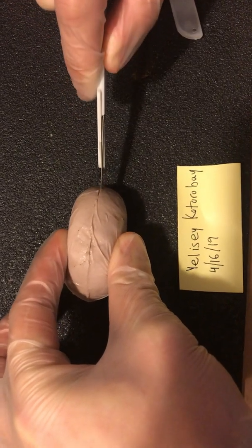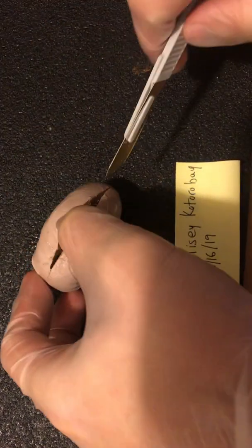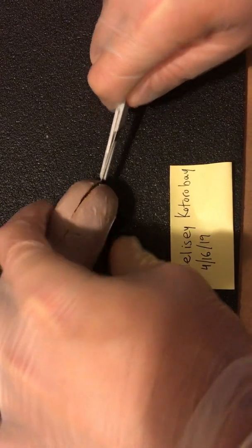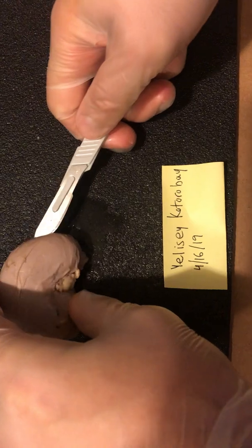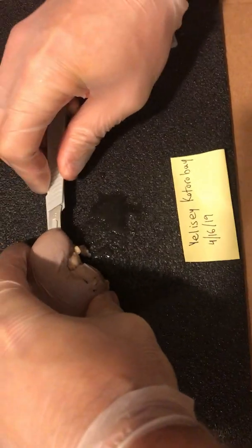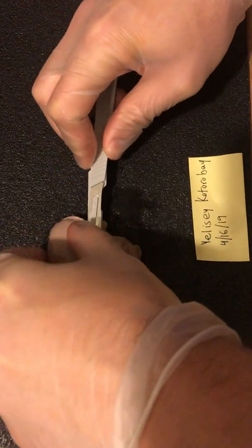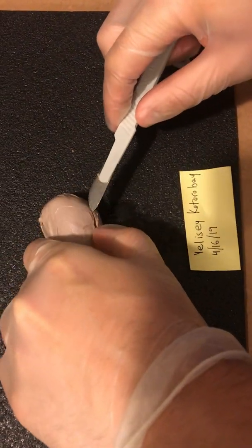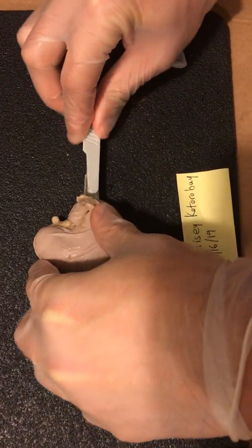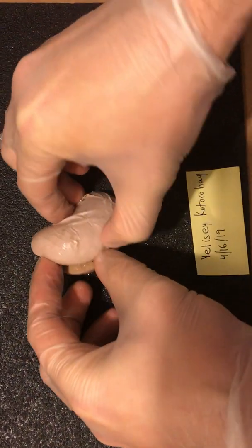Okay. Almost there. Gonna keep going. Alrighty there then.